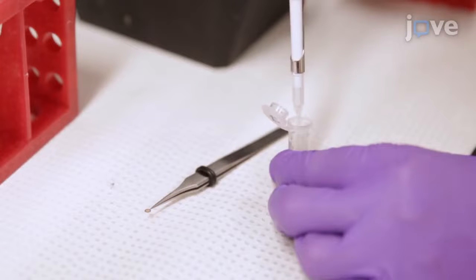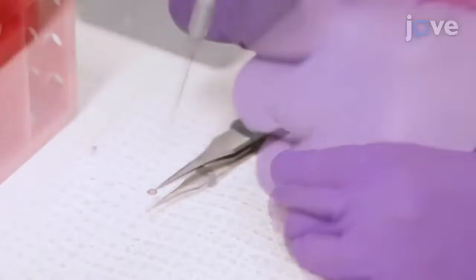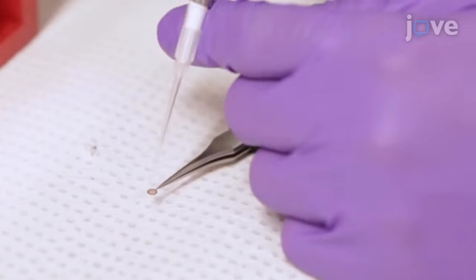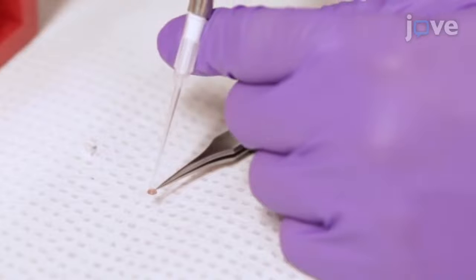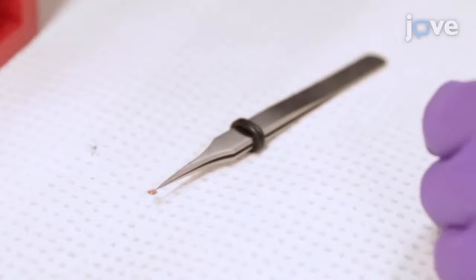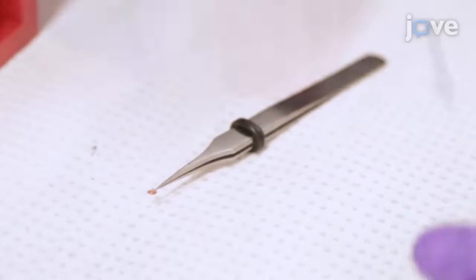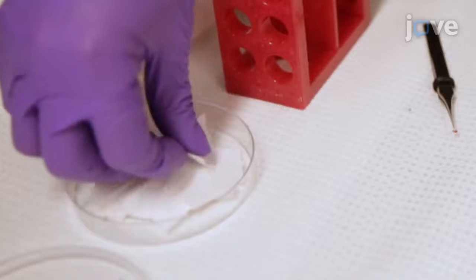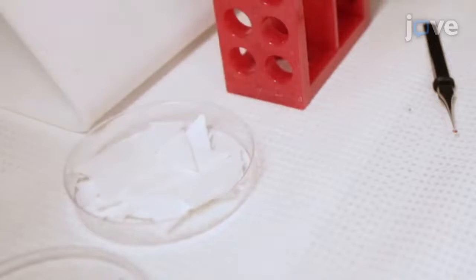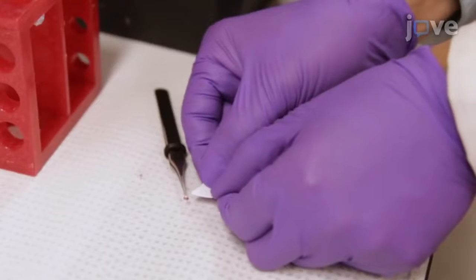Following ionization, hold the grid in tweezers and add 2 microliters of the HEV nanoparticle sample to the grid. After 15 to 30 seconds, blot the grid with filter paper.